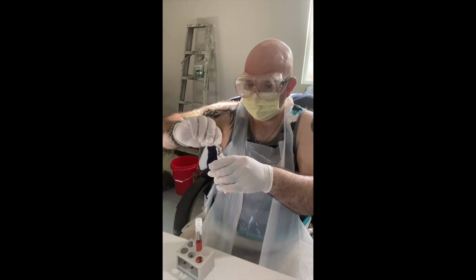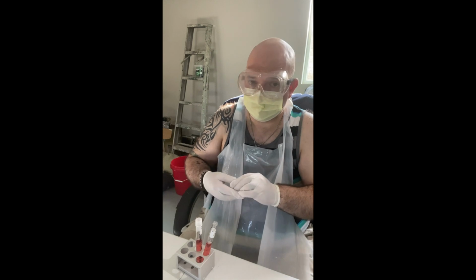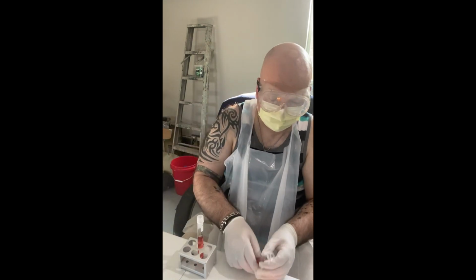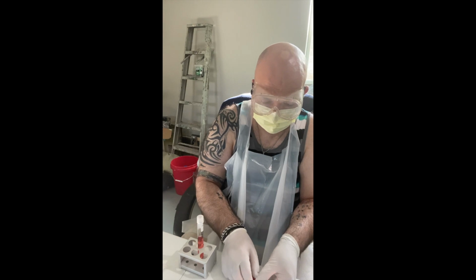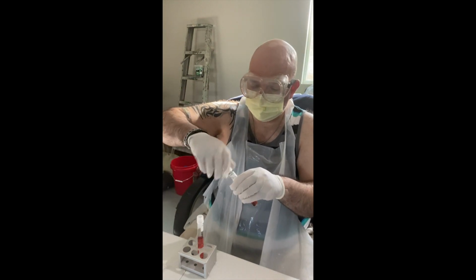A little bit more. And since the crystals are a bit more coarse in comparison to the glucose, it is easier to pour just half of the granules, I mean. So that's that part. That's flamed. Lid.